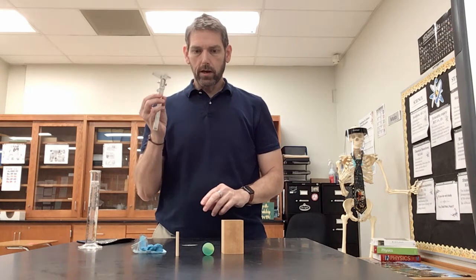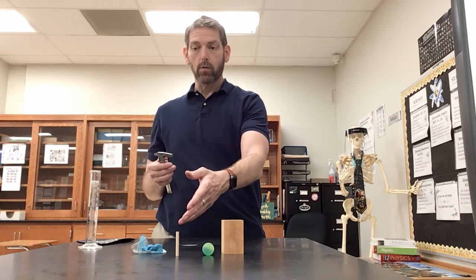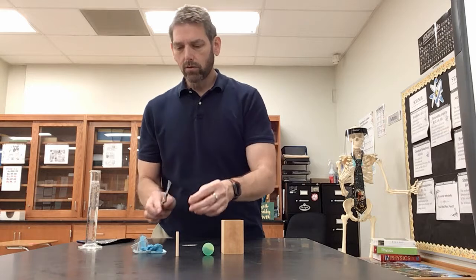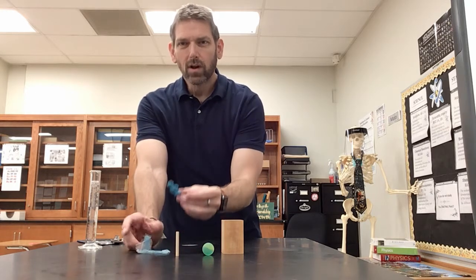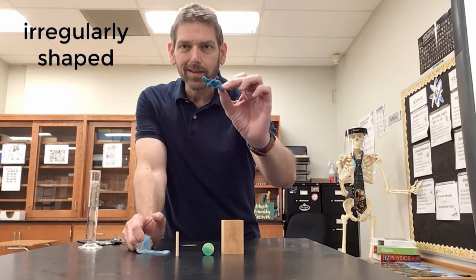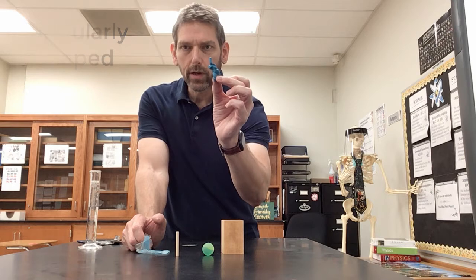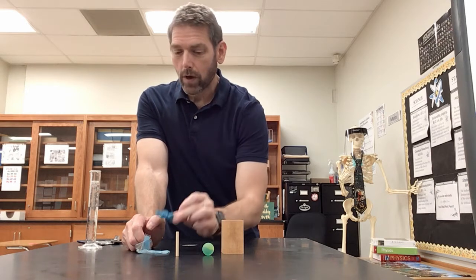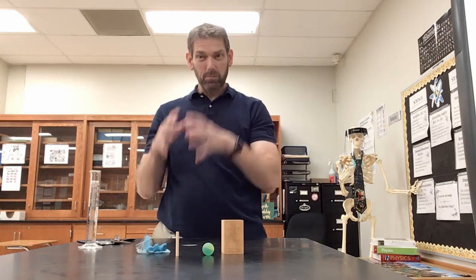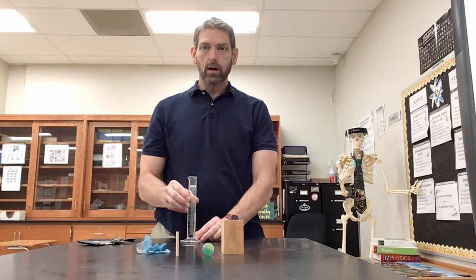That could definitely come in handy when you have to measure something about the sphere or this rod, right? But if you think about it, it's a little harder to be useful when you're talking about something that's so irregularly shaped like this piece of clay is, right? And the way that I just sort of twisted it and turned it. And so we have another way of approaching and figuring the volume of that. How much space is that object taking up, by using a graduated cylinder.